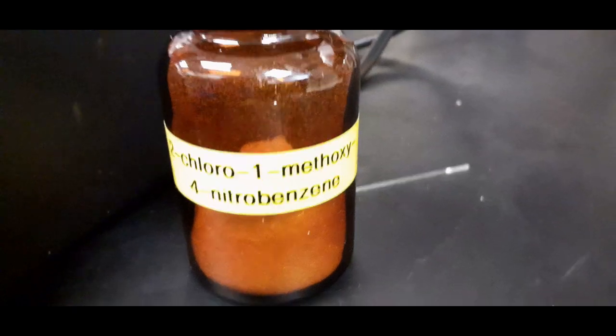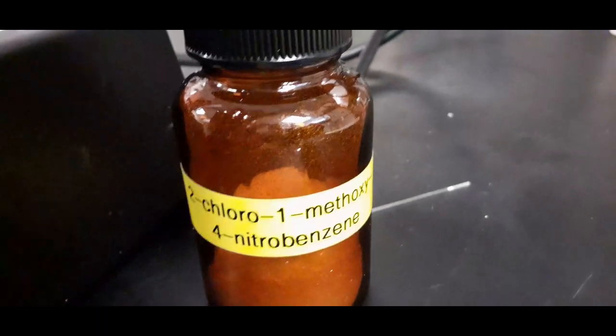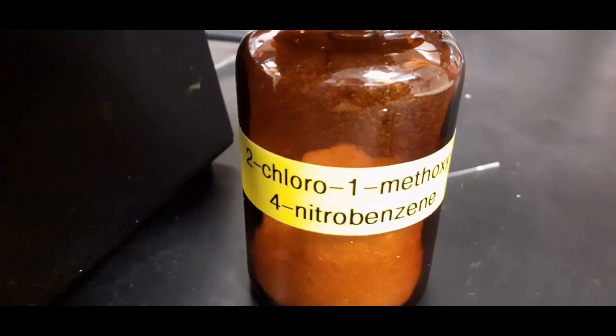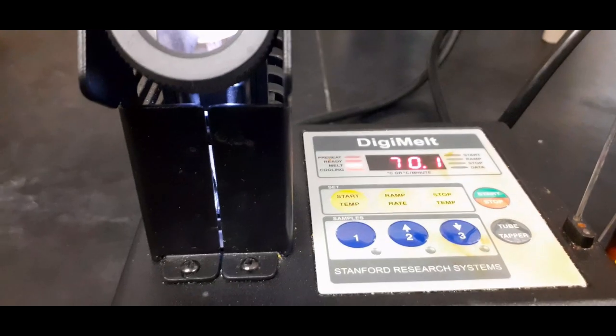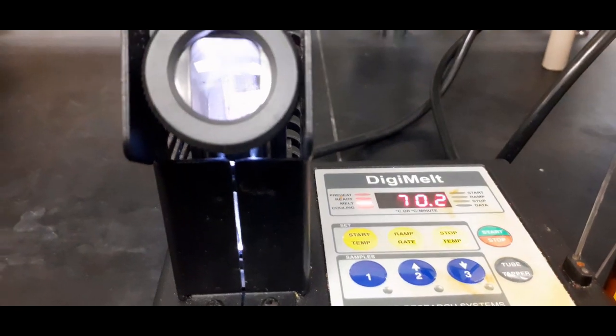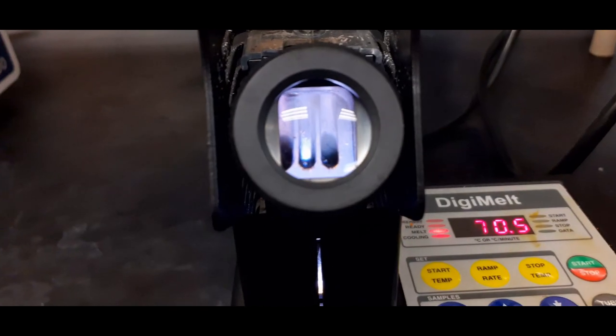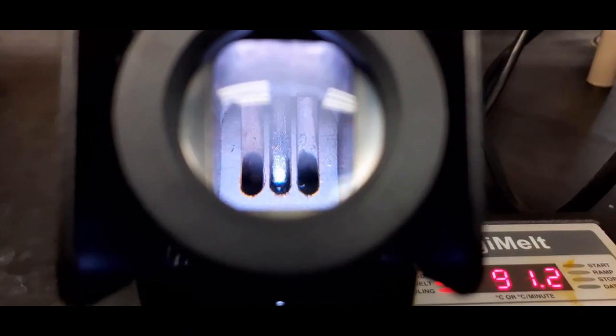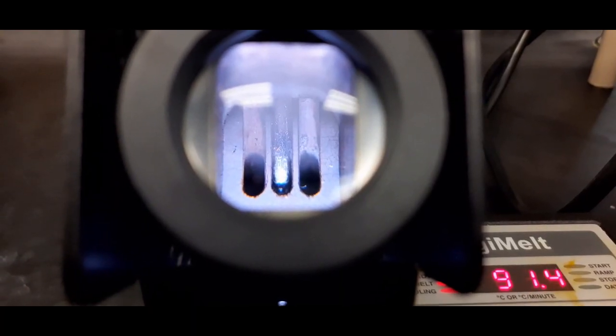For the mixed melting point, the crystals are mixed with the shown compound. Note the melting point of the mixture. This is required to identify the product formed.